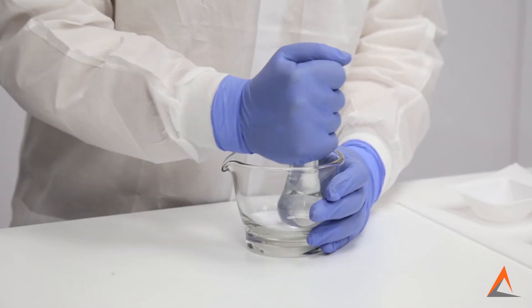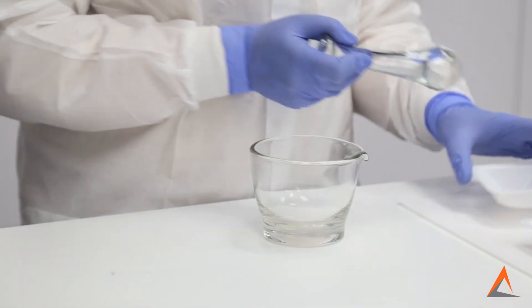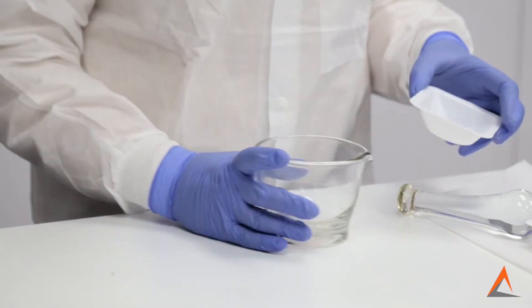This grinding technique will allow you to reduce the particle size of your powders and, in turn, aid in providing the best possible preparations for your patients.